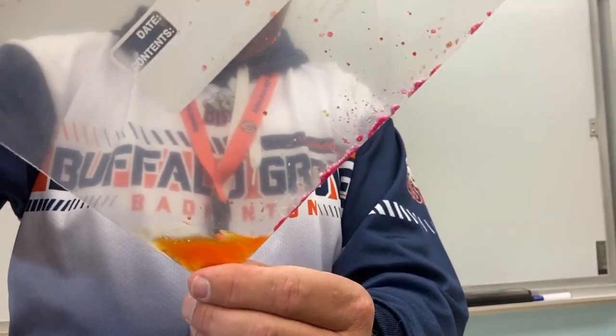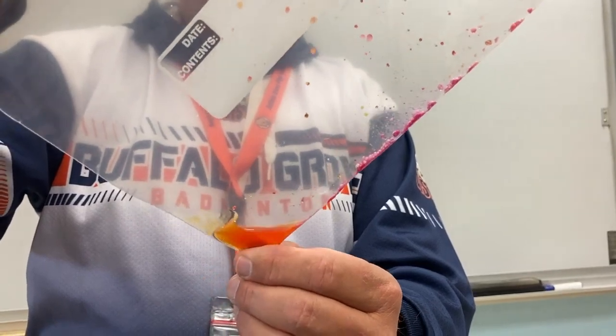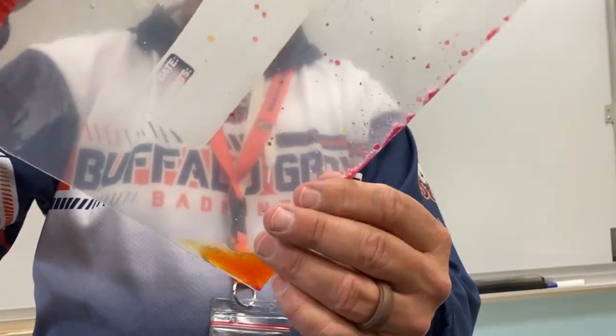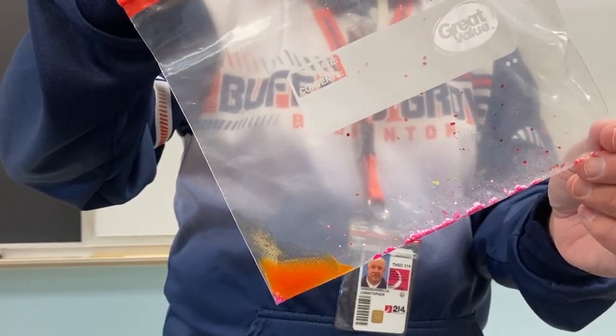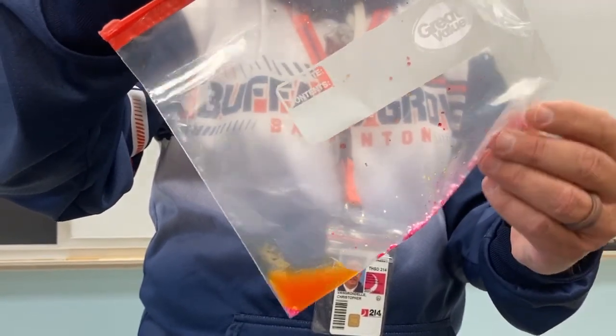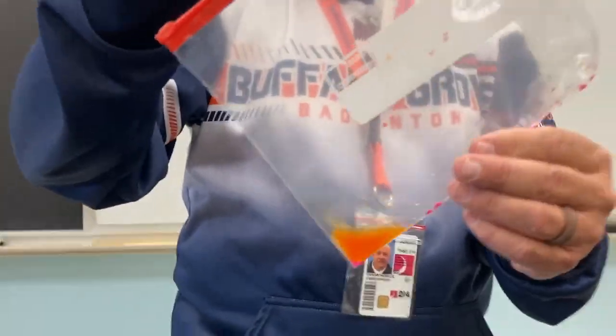Have you noticed, is it getting warmer or colder? It is certainly getting warmer. Okay, and still no bubbles though, right? No. All right, so we got really one result for this. Even though you see a color change, it's not the one that we are studying. So really, it just made it warm, right? Yes. Okay, very good.